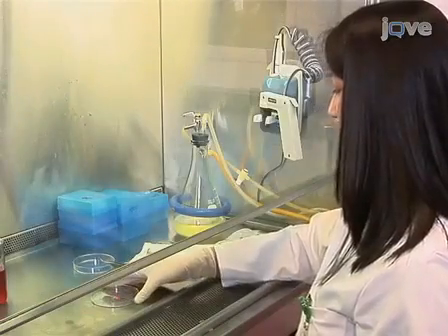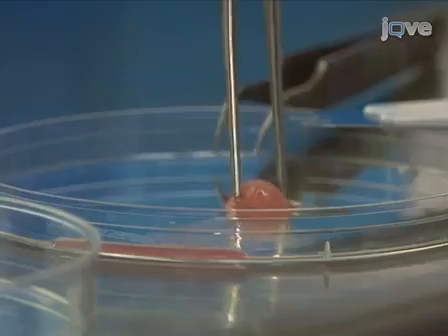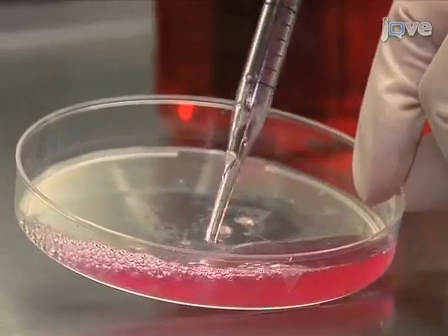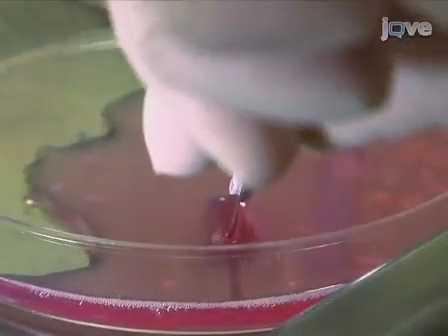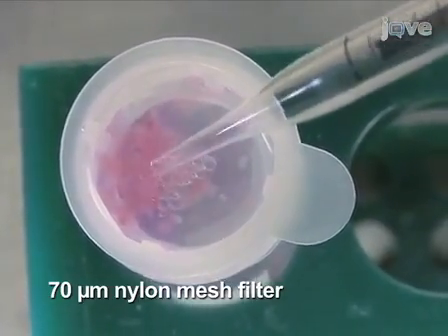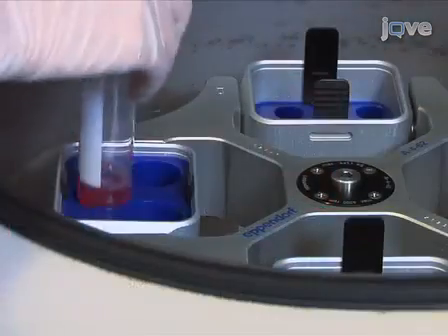Working under a tissue culture hood, prepare subcutaneous tumor cells for transfer to the intracranial compartment. Begin by placing excised flank tumors into tissue culture dishes. Using a scalpel, mince the tissue. Then, using a pipette, mechanically disrupt the tissue to create a cell aggregate suspension. Next, pass the cell aggregate suspension through a strainer with a 70 micrometer nylon mesh filter and collect it in a round bottom tube. Repeat this process for a total of 3 times to produce a single cell suspension suitable for intracranial injection.